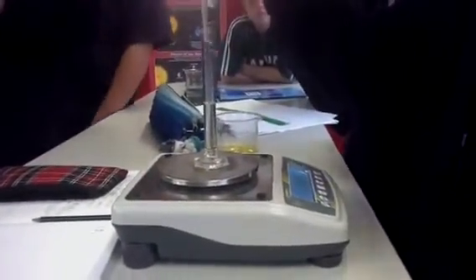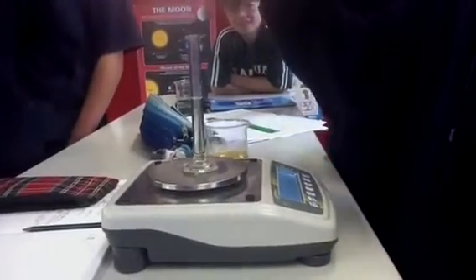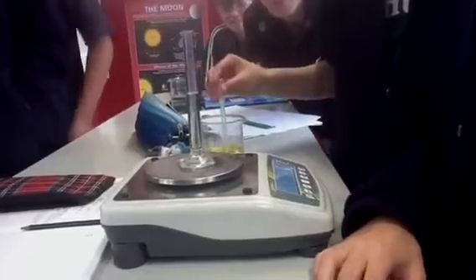Okay, so what are we measuring here? The oil. It's very interesting. So we're just looking at this. Now reset the scales to zero. Go for the four. It's a big one. How much does it weigh? Seven point nine three.